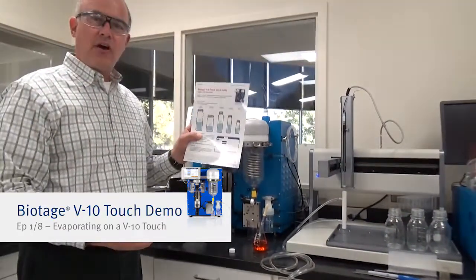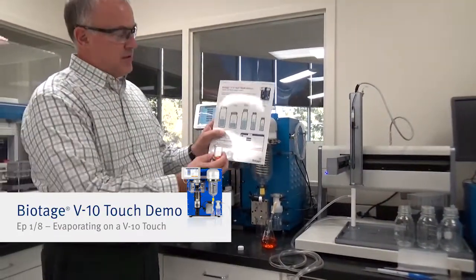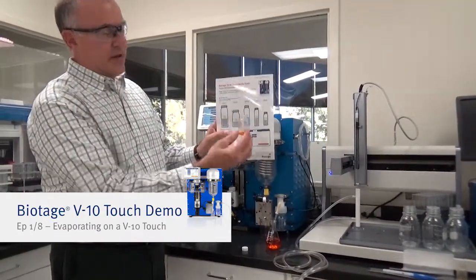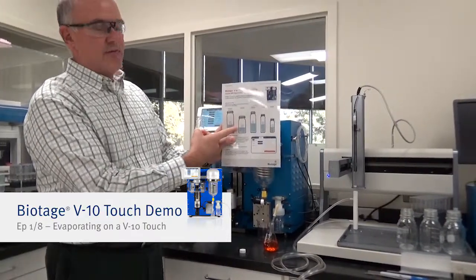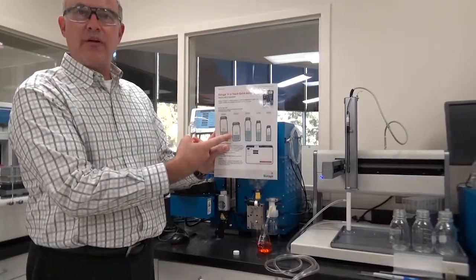And we've got this card that's really handy for the job. You just want to make sure that the vial you're using doesn't have more in it than what's shown in the graphics.